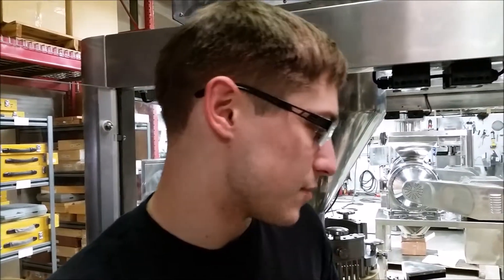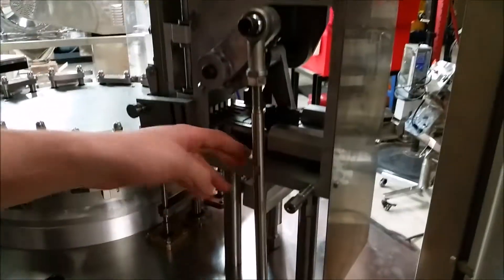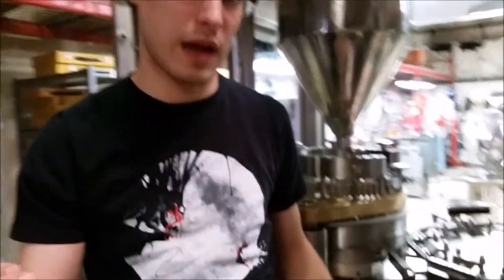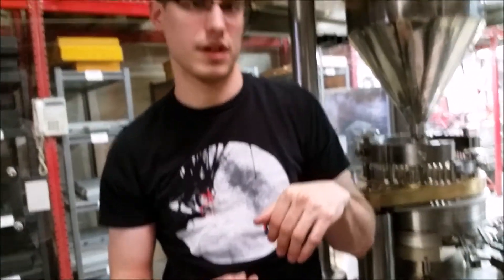We're going to look at how to orient capsules so they fall into their segments correctly. There are three adjustments for this: the link rod, and then two C blocks within the case itself — one for horizontal and one for vertical movement. As you adjust those, they change where the forks push the capsules out to and where the vertical forks come down on the capsules to affect the rotation.